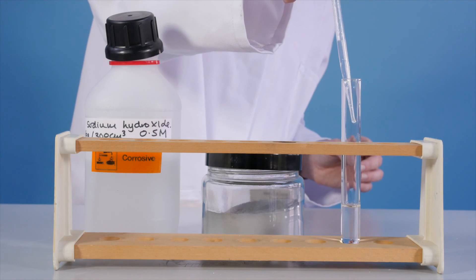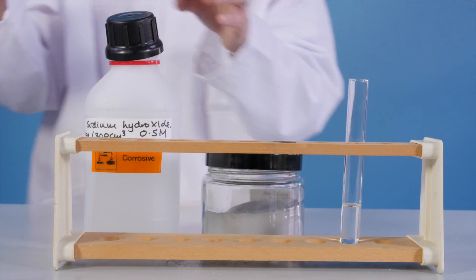In this video we will complete a positive test for nitrate ions in solution using aluminium powder. Dilute sodium hydroxide is added into a solution of calcium nitrate.